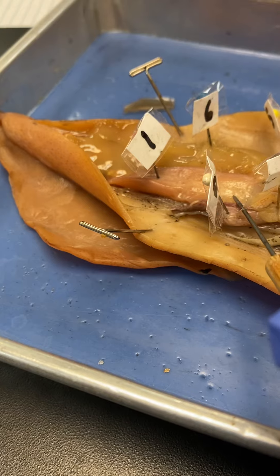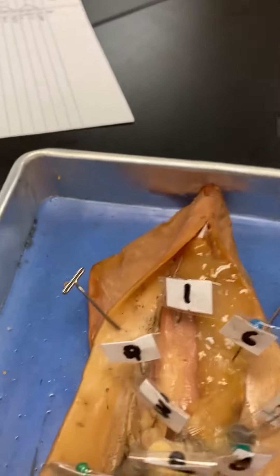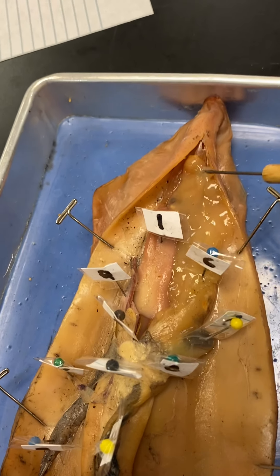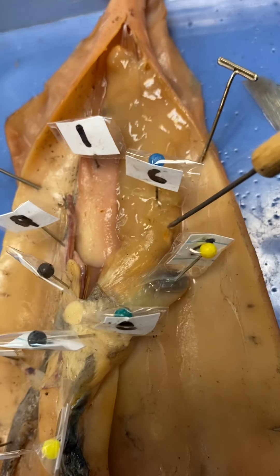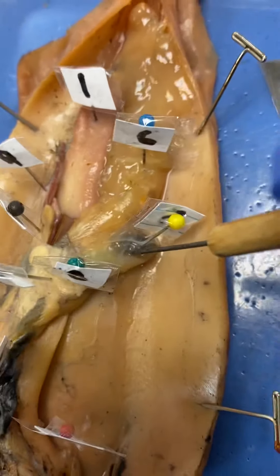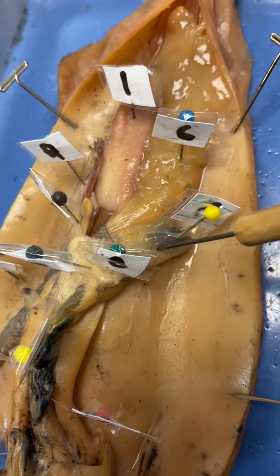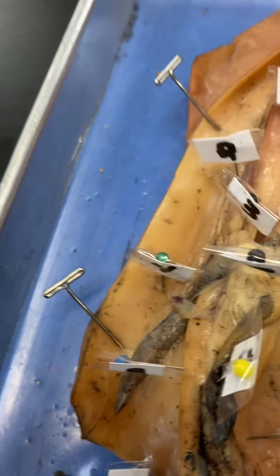After the sperm is created, number three — the structure like a little gland that's connected to the vas deferens — that's the spermatophore gland, or the sperm gland, that produces the sperm packet. And then number four, this tube right here is the vas deferens, and number one right there is the testes. So those are the male structures.